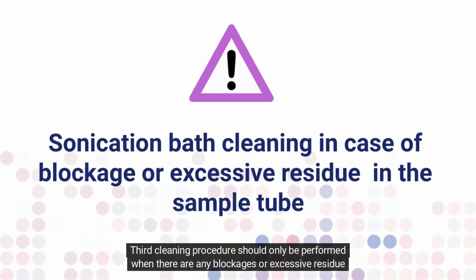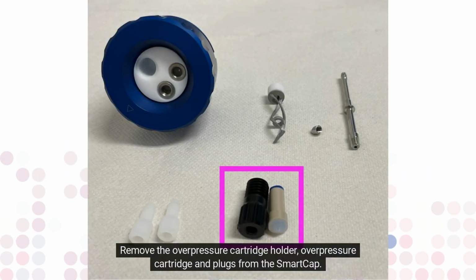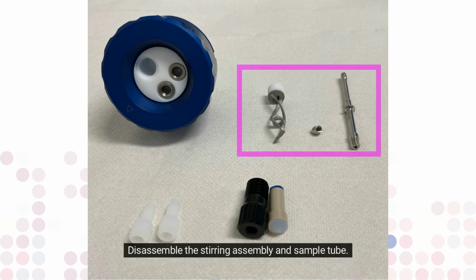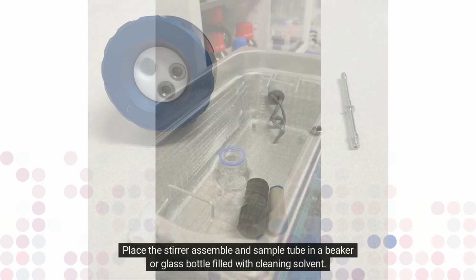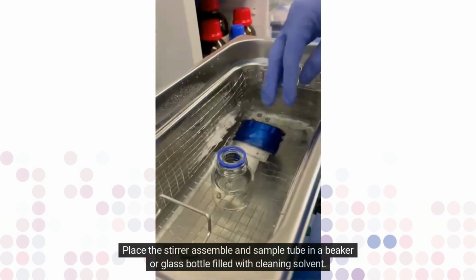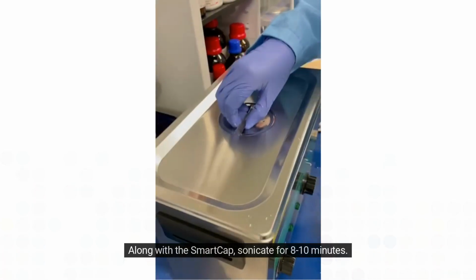Third cleaning procedure should only be performed when there are any blockages or excessive residue in the sample tube. Remove the overpressure cartridge holder, overpressure cartridge and plugs from the SmartCap. Do not put these in the sonicator. Disassemble the stirring assembly and sample tube. Place the stirrer assembly and sample tube in a beaker or glass bottle filled with cleaning solvent. Along with the SmartCap, sonicate for 8 to 10 minutes.